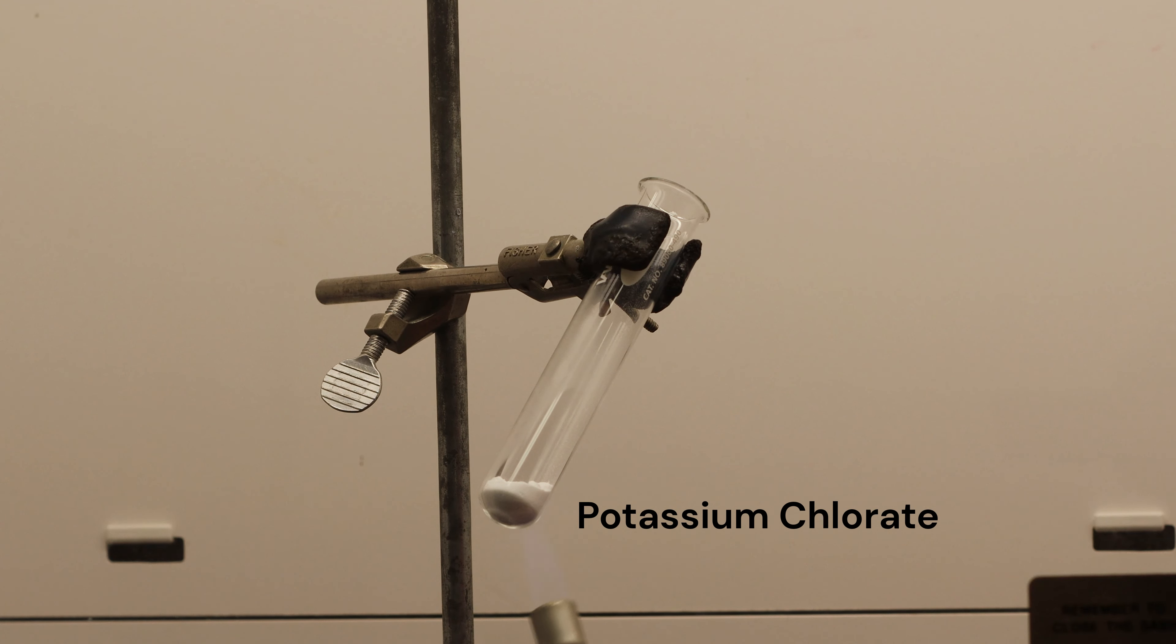I want to show you an exciting reaction between potassium chlorate and sugar. I've set up this large test tube with a couple of grams of potassium chlorate and a fume hood for this demonstration.